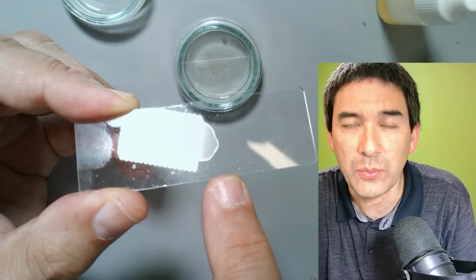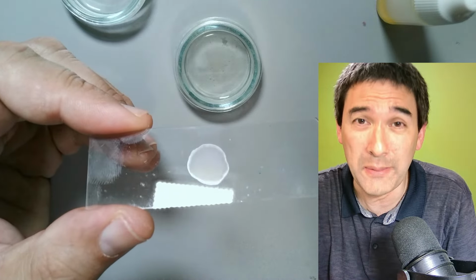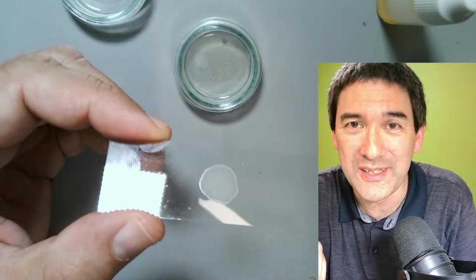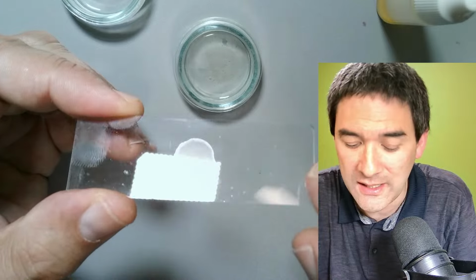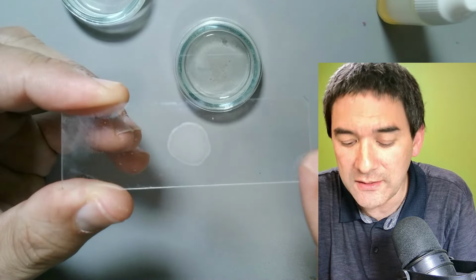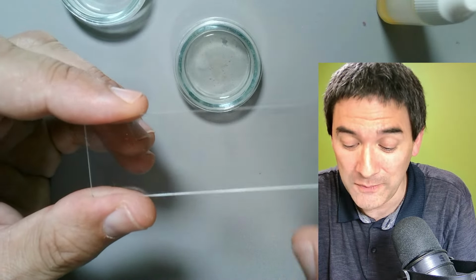Why do they stick? It's a little bit like the proteins in an egg. When you put an egg into a frying pan, it sticks to the frying pan because the proteins in the egg form cross linkages with the pan, in this case the glass. By applying heat, they will also be baked to the glass slide. You do not want to exert too much heat, otherwise it's going to burn, and you don't want that either.